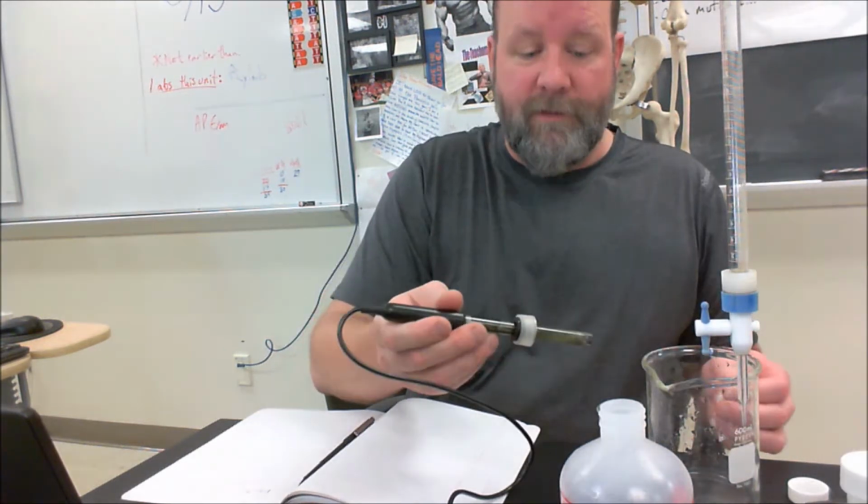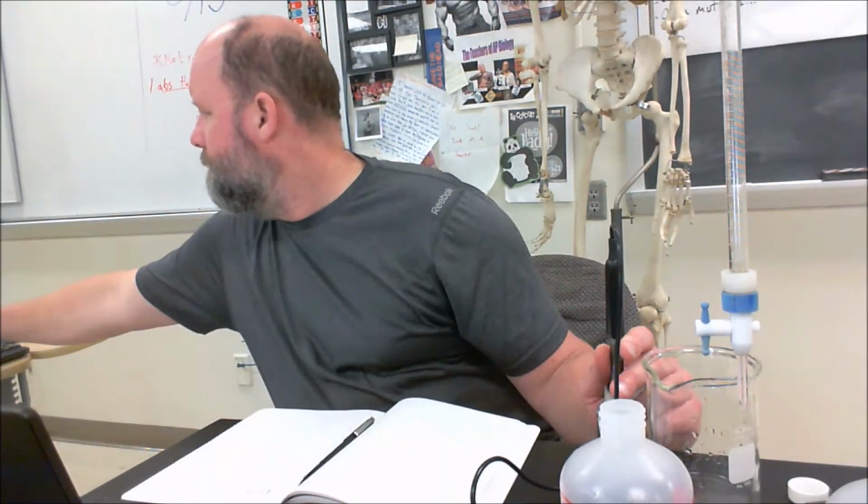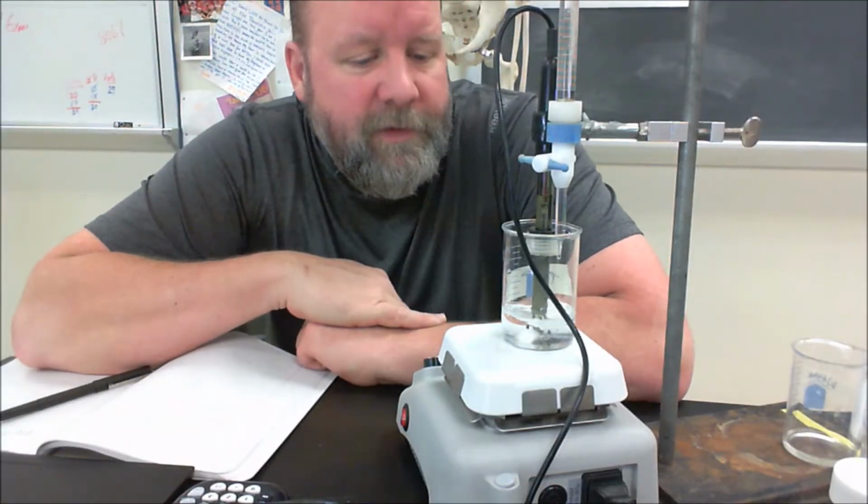Then rinse it again. I'm going to give it the standard of pH 10. Put that in. It is 10, right? So I'm all set up here. Let's take a look at what I've got.